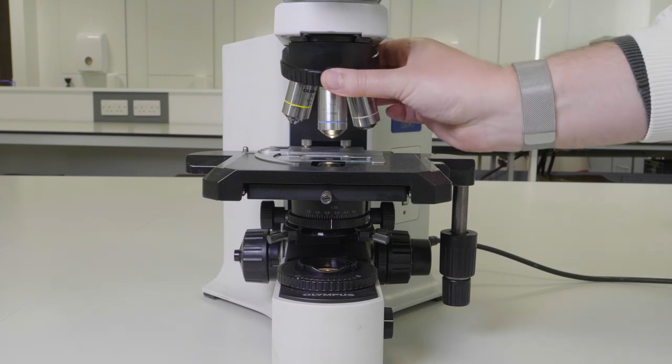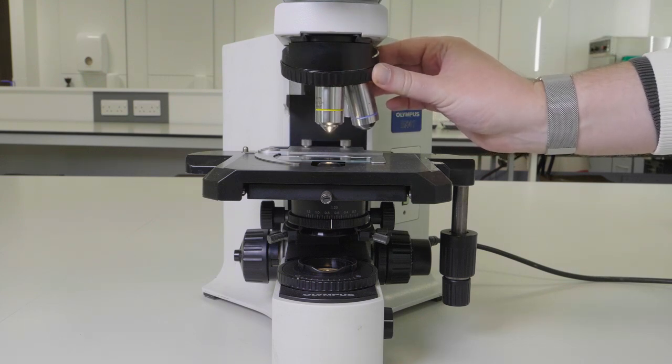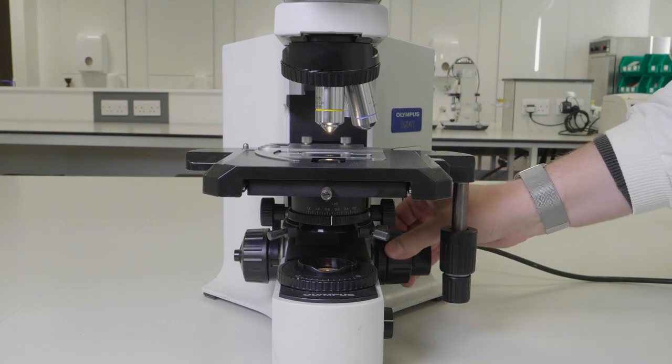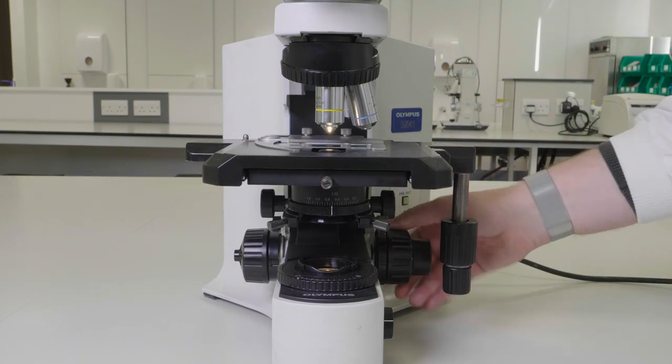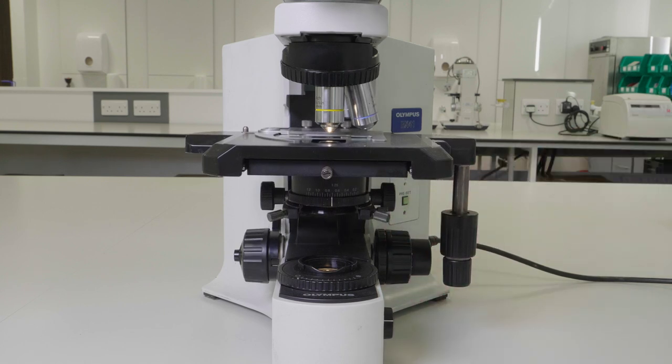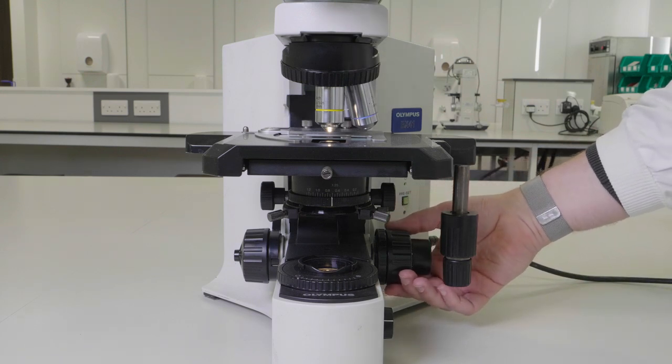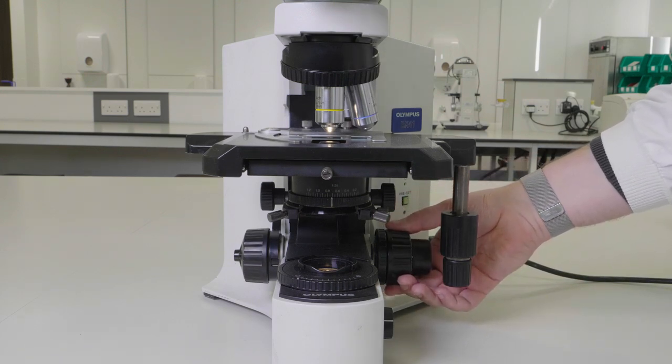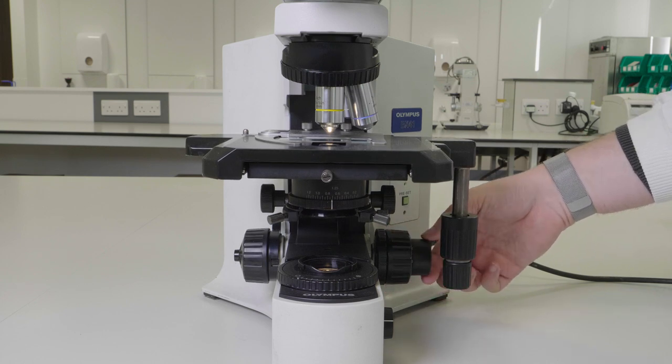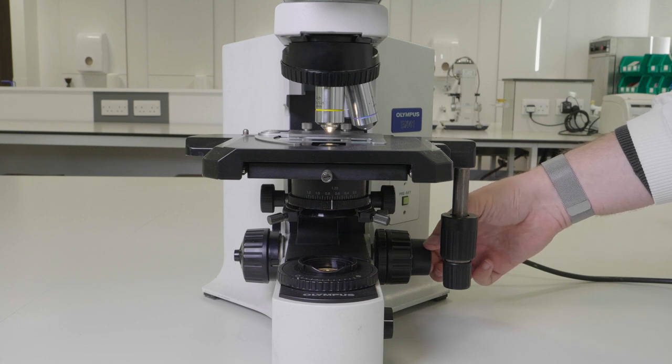Select the 10 times objective and raise the stage to its uppermost point. Then, whilst looking down the microscope, lower the stage until you can see something and bring it into fine focus using the fine focus dial.